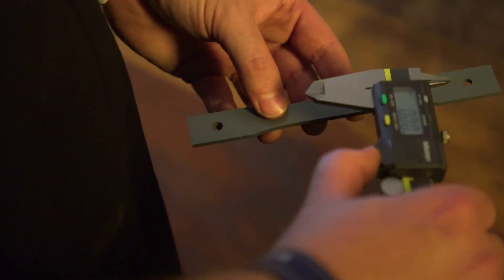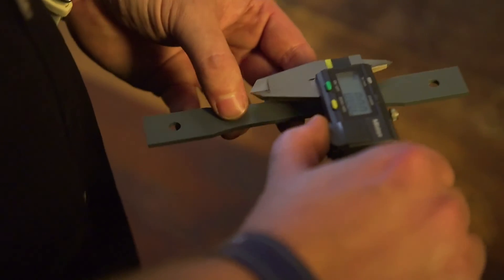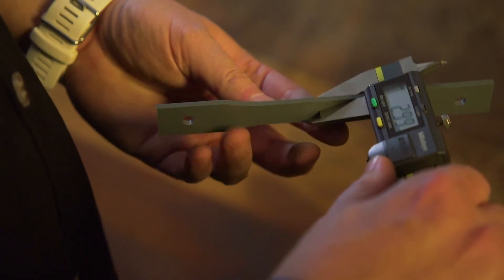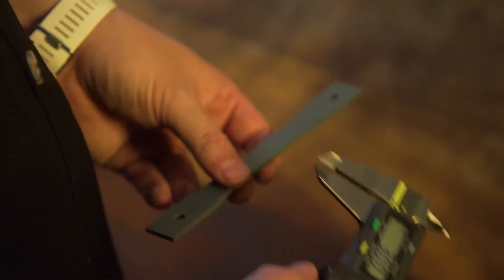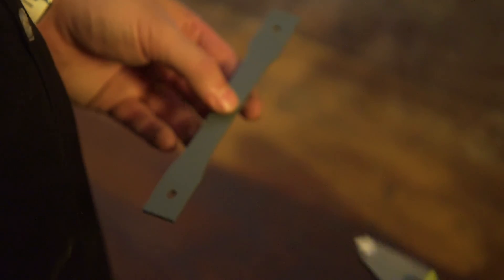In order to determine the elastic modulus of this material, I need to know the geometry of the specimen. In this case, I am measuring the width and the thickness using a digital vernier caliper. These measurements I will use for the area calculation which I need in order to calculate the stress in the material.